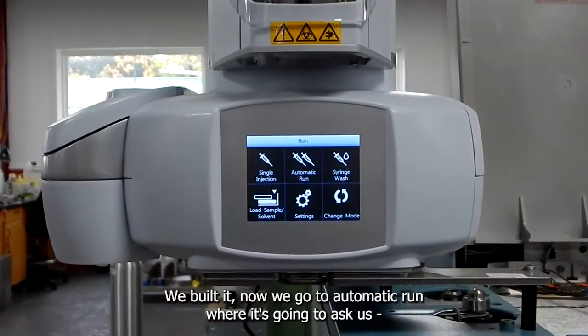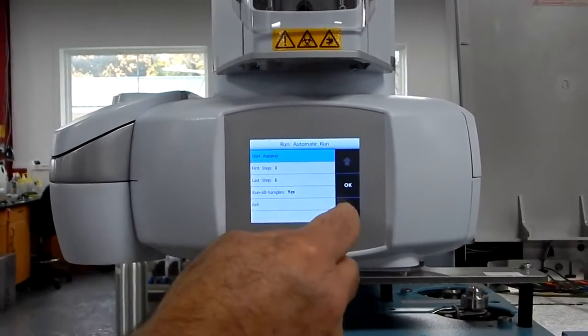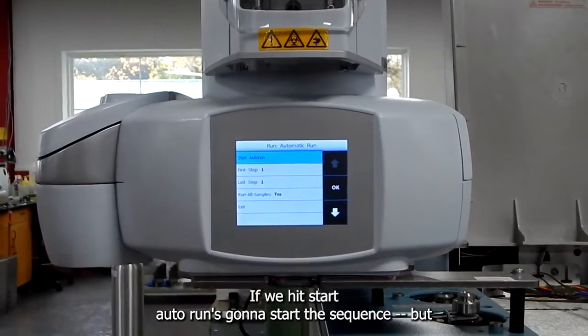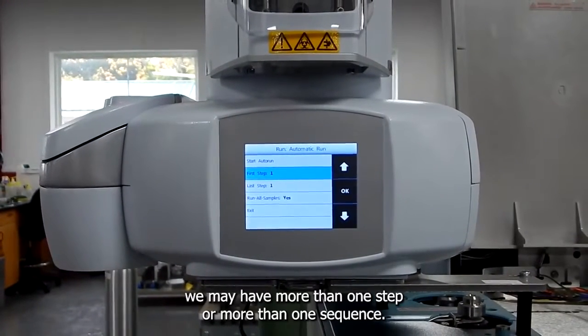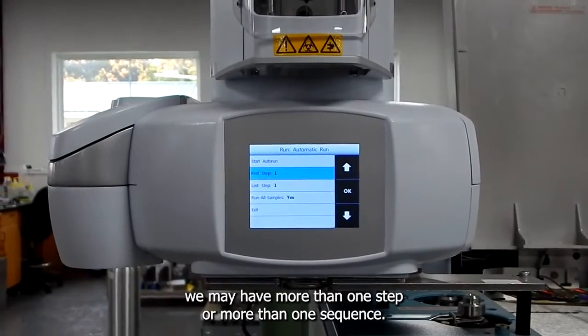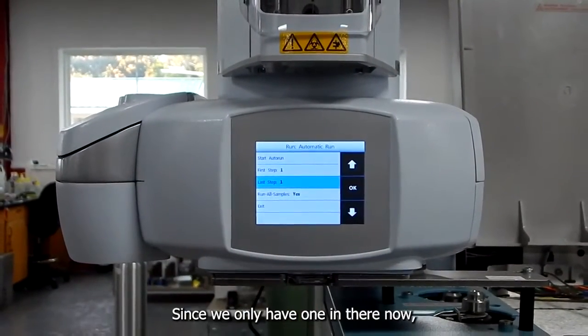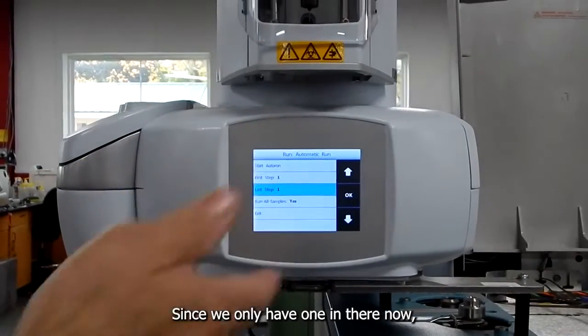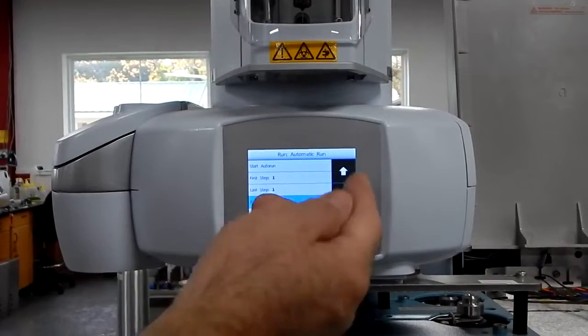We built it. Now we'll go to automatic run, and then it's going to ask us, if we hit start auto run, it's going to start the sequence. But we may have more than one step or more than one sequence. It'll tell us what's the first one, what's the last one. Since we only have one in there now, one will be there. We'll run all the samples, yes.